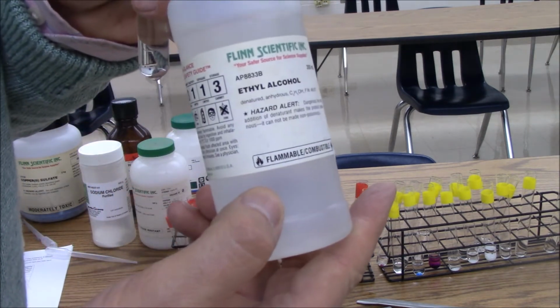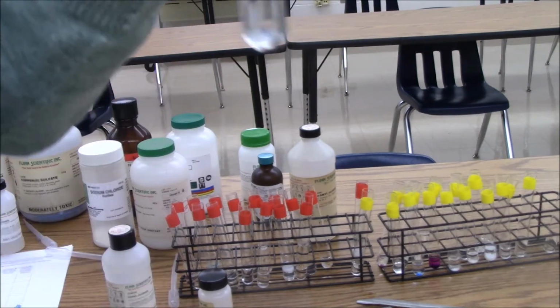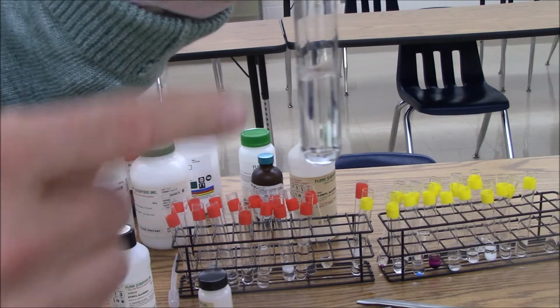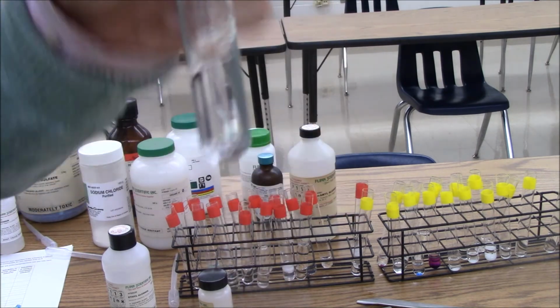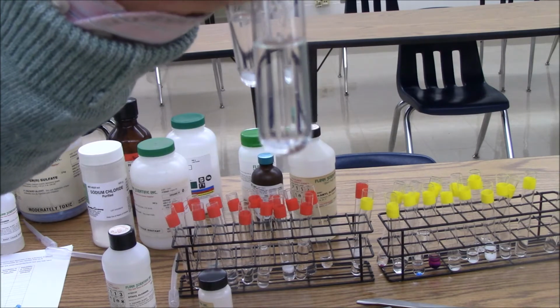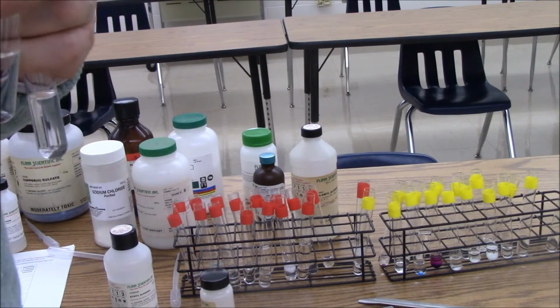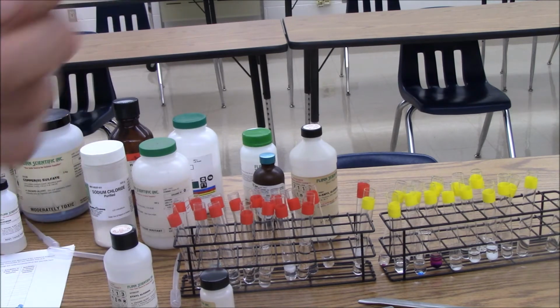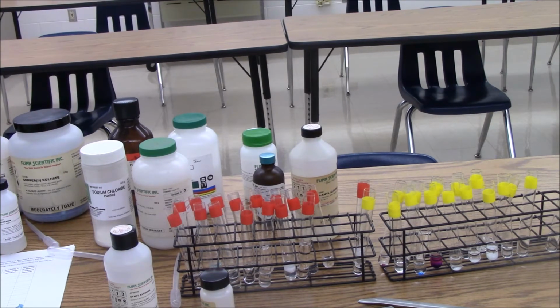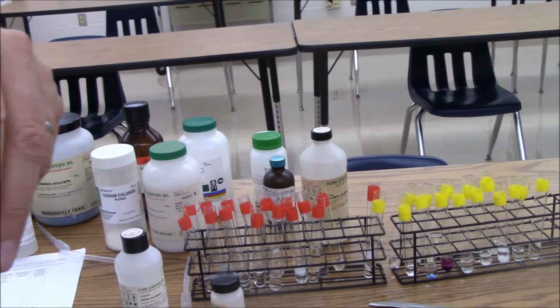Here's some ethanol, sometimes called ethyl alcohol. Here it is in the polar water. It's miscible. And here it is in the nonpolar hexane. So this is a chemical that's soluble in both. It's kind of moderately soluble. It's close enough in polarity to the water that it dissolves or mixes, and it's close enough to the hexane as well. So we've broken our streak of things that are either or.